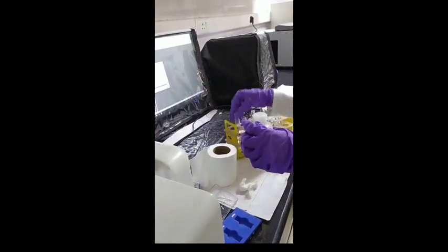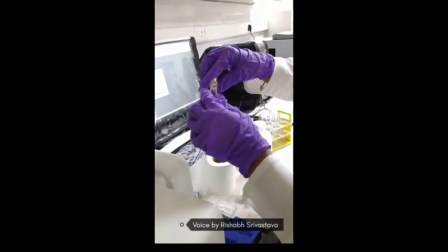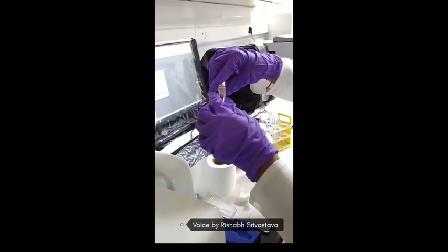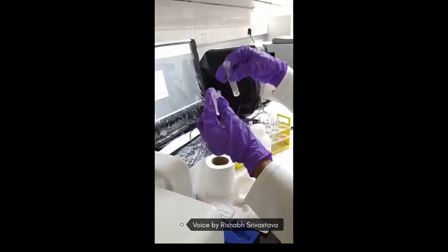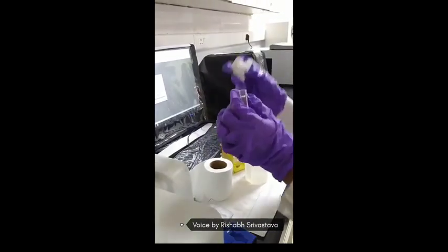Similarly, we are going to pour pH 4.5 sample and one pH 4.5 blank sample at both ends and run it at both wavelengths, 520 nanometer and 700 nanometer, and record all the absorbance values.